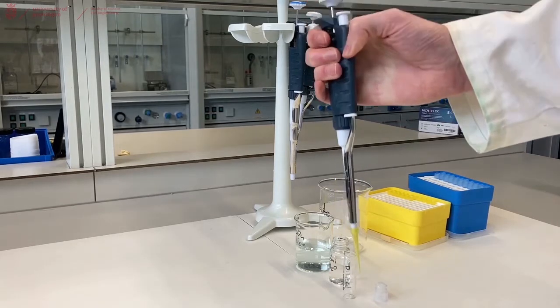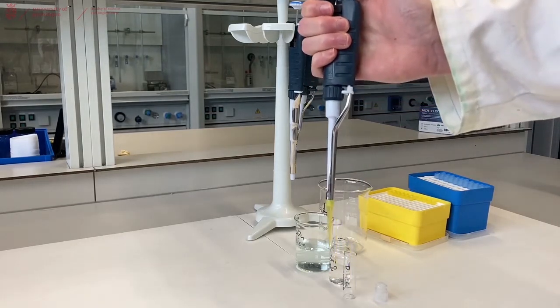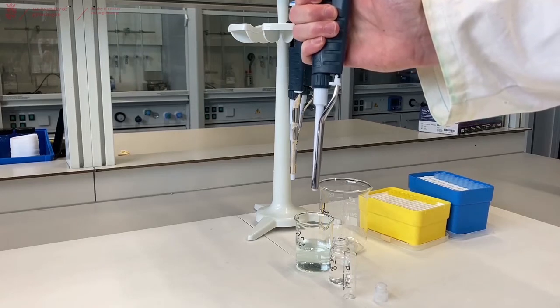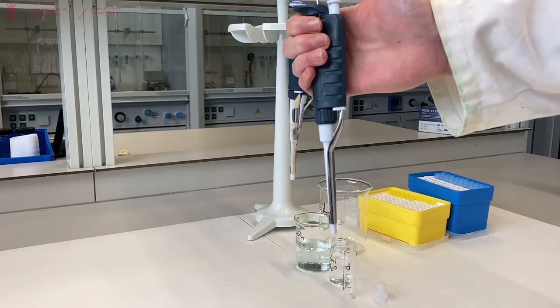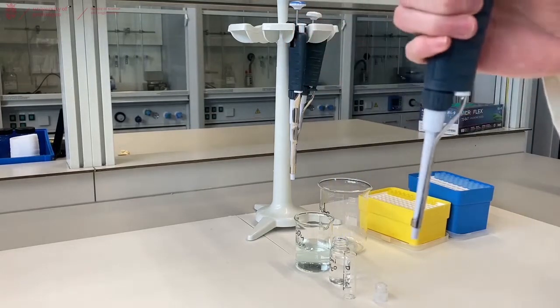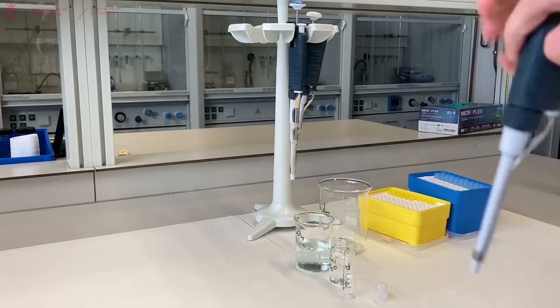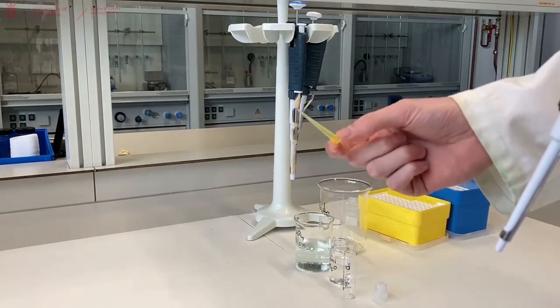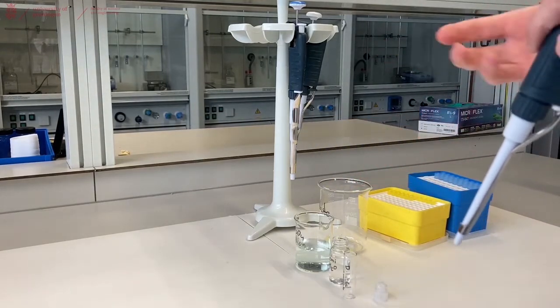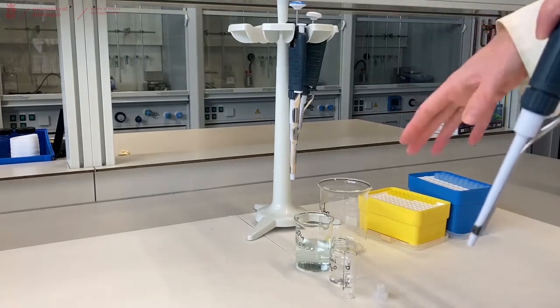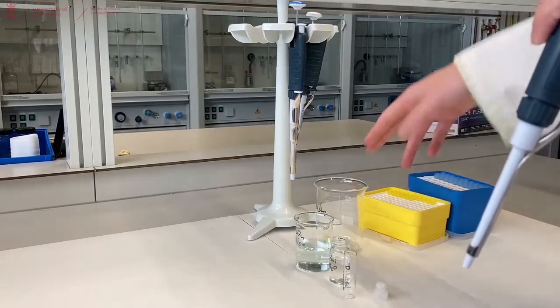There's also a button in the back which you can use to eject the pipette tip. That's used to get rid of the pipette tip without you actually touching it with your hands and possibly contaminating them. Always dispose of pipette tips into either a small beaker or directly into the solid waste, then at the end of the day dispose everything in your beaker into the solid waste.